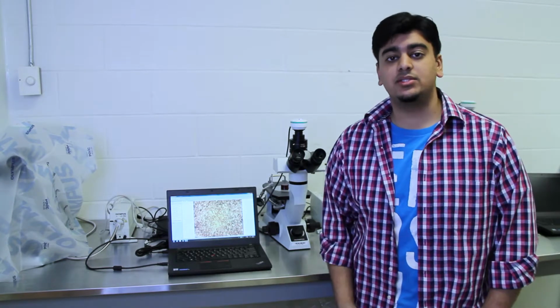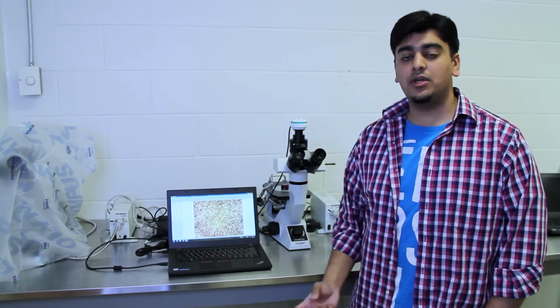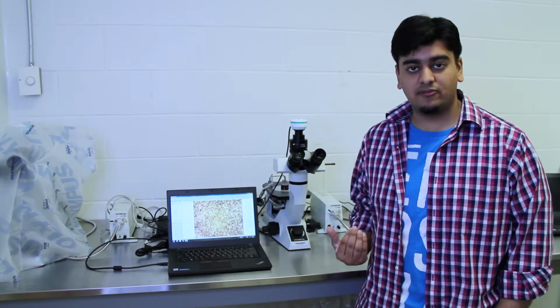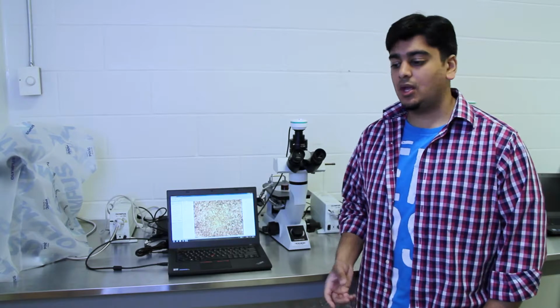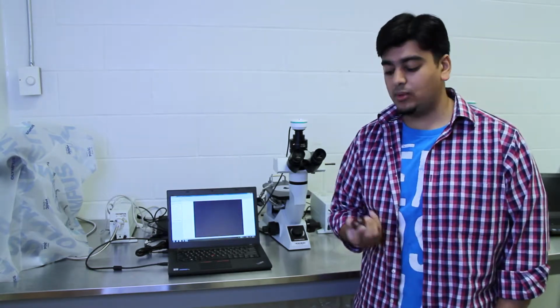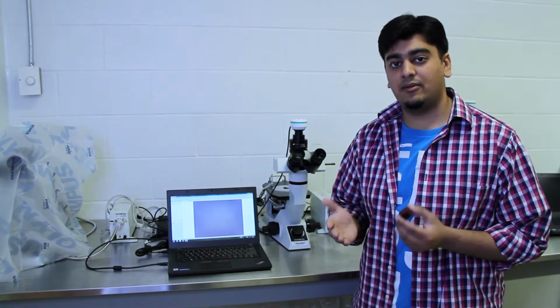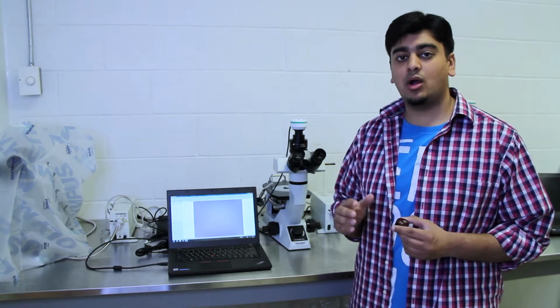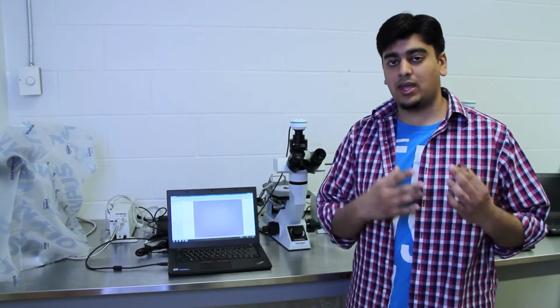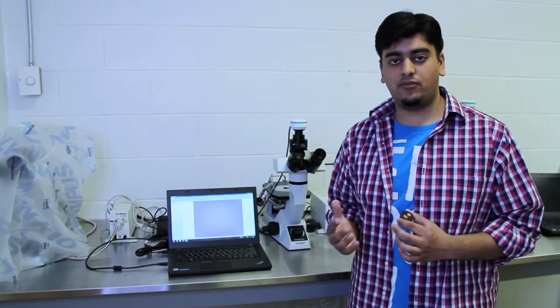So one thing you'll notice when you're getting your sample into focus is that it was much easier with the inverted microscope as opposed to the reflective microscope. And this is because of how we have our sample. Before, on the reflective microscope, it was upright. So the bottom of this surface may not have been flat. It may have been uneven, which has caused the frame that we had in focus to be partially in focus. So not all of what we saw was in focus.